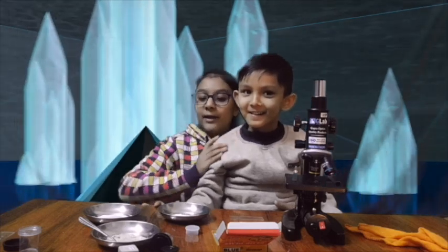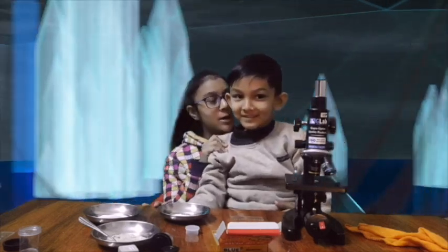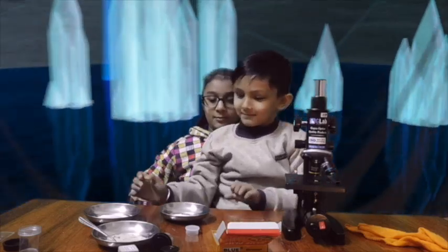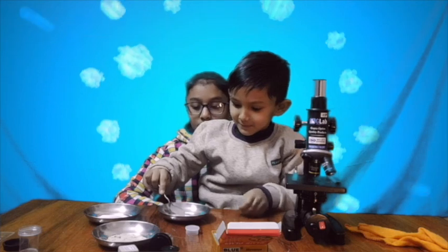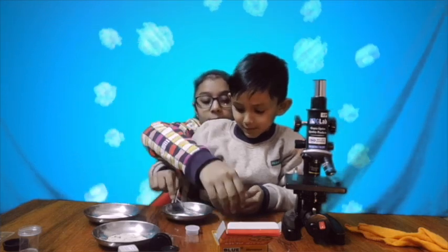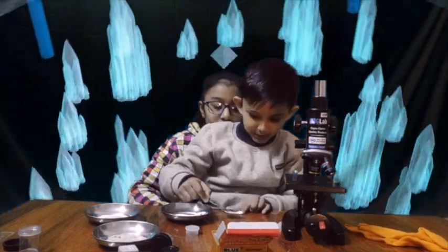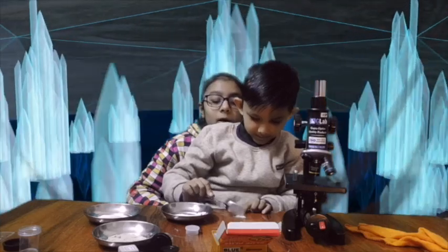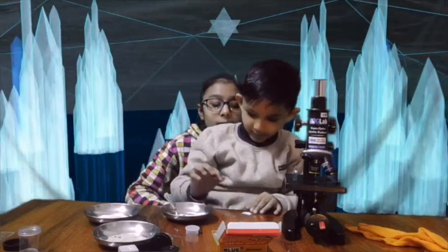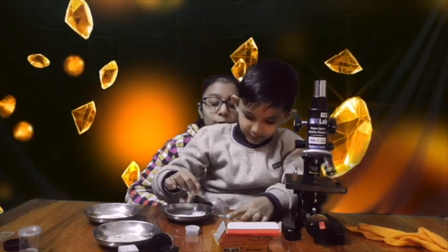Okay, for the next one Vishu is going to put the next slide in the microscope since he begged so much. Go ahead. Okay, this is the one you need to put. I need this one first. No, put it here only. Put it already. Okay, I think I need to just put it in here. Why are you overreacting so much?